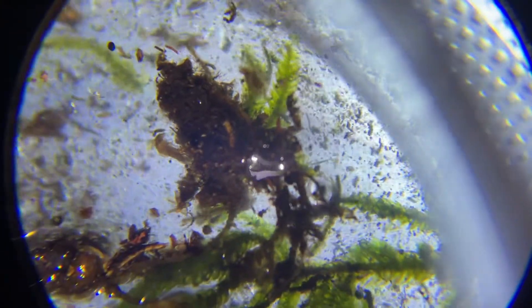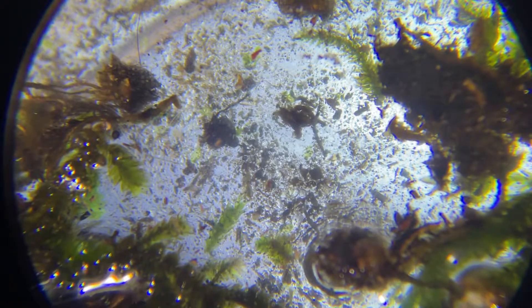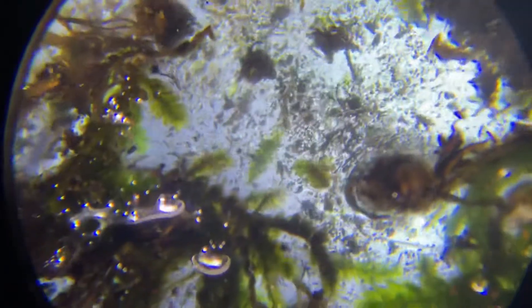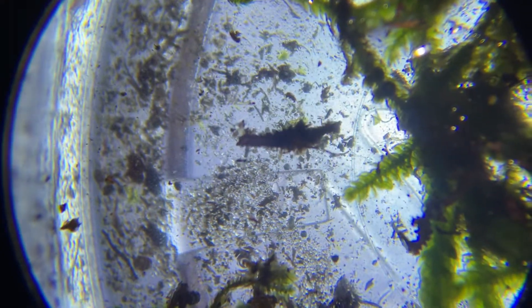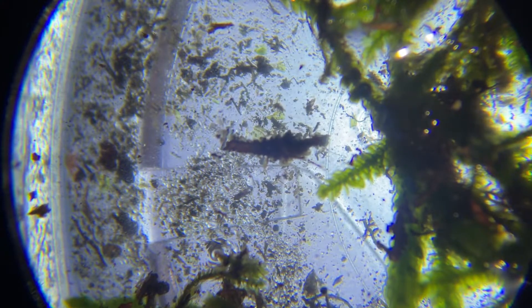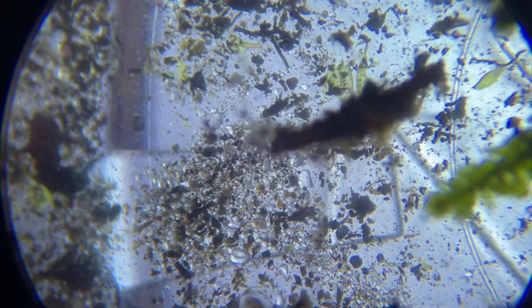I try to go below the surface and just look at the gravel on the bottom and see if I see any motion. You just take one section at a time. I kind of know what I'm looking for — if you don't, you're not gonna find them, because they're very very small. At this magnification they'd be about as big as one of those pebbles, maybe a little bigger, but not much.